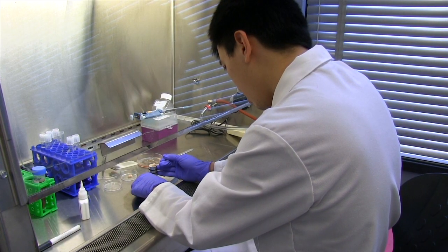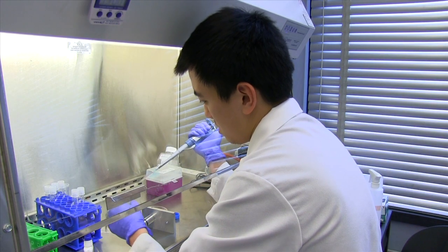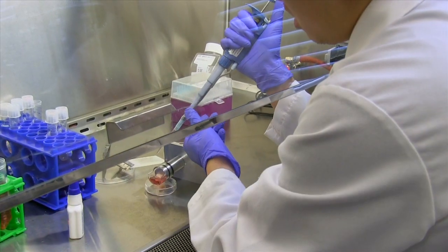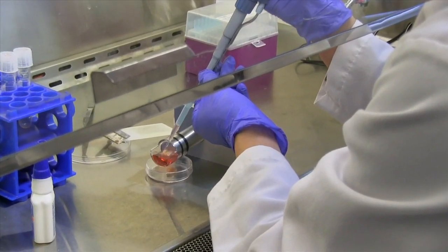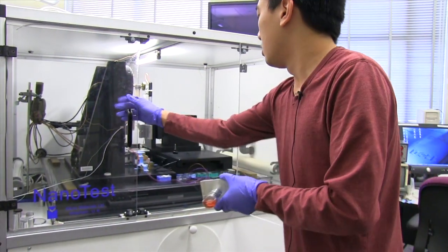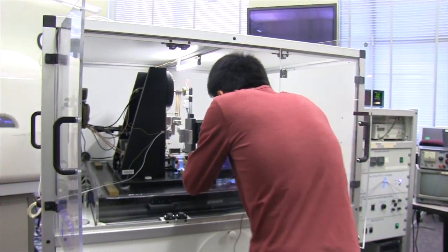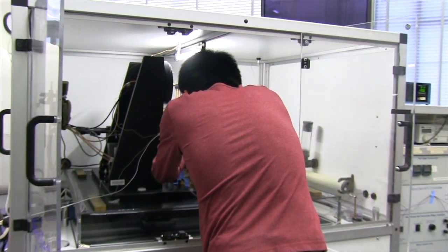I put this fluid cell, this container, around the sample post so that the tissue sample remains hydrated throughout the mechanical characterization process. I'm just putting the sample stage back into the micromaterials nano-indenter.